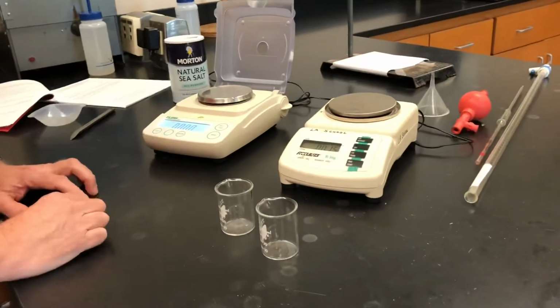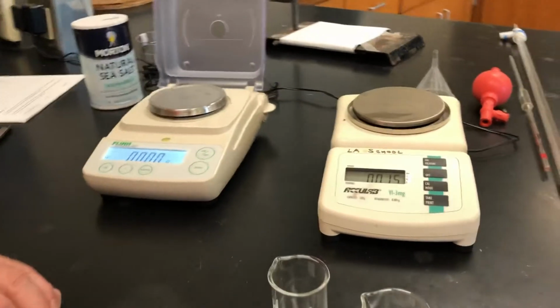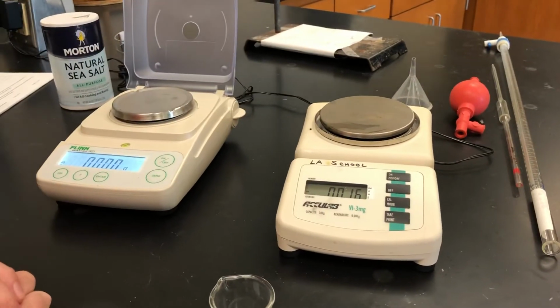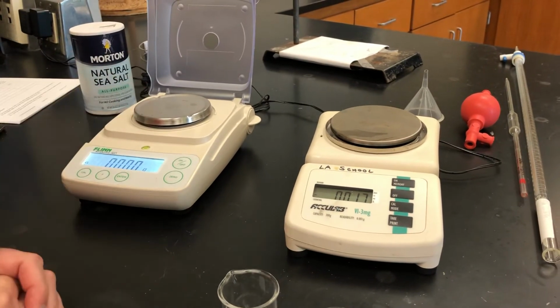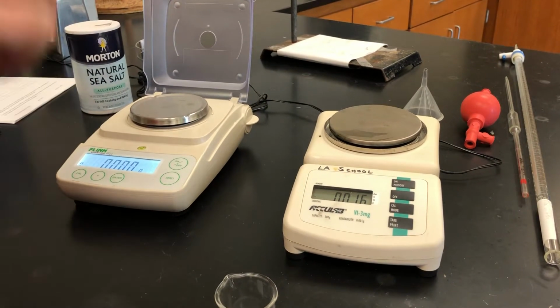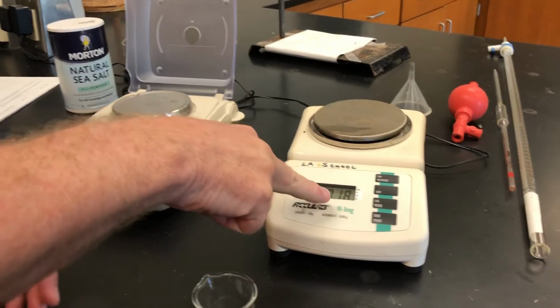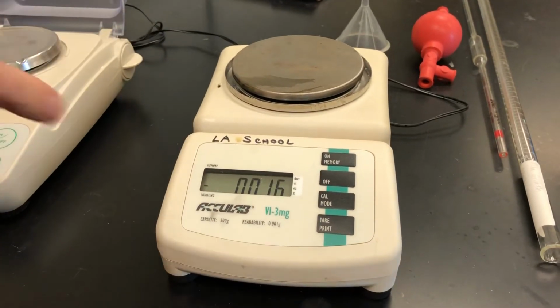So I have two electronic balances set up. These are different brand names right here. And when you turn them on, they typically go through a little self-test thing. So I recommend that you turn them on before you're ready to do your experiment, and I'll just say kind of warm themselves up. This one right here is actually reading something. This would be common for an electronic balance.